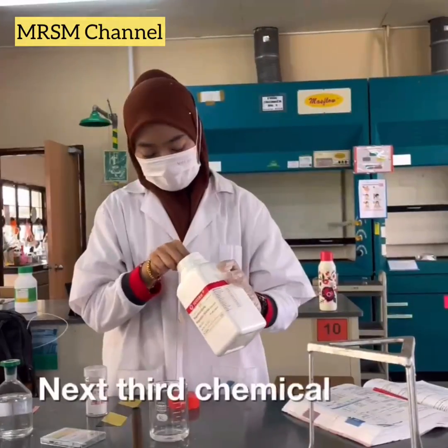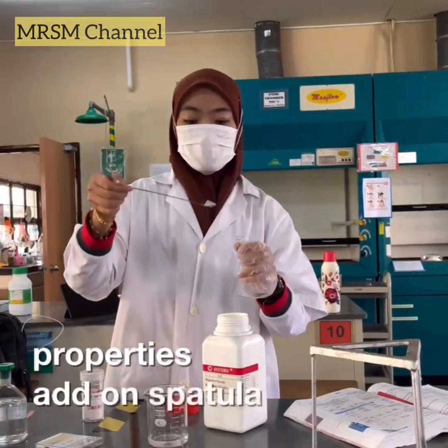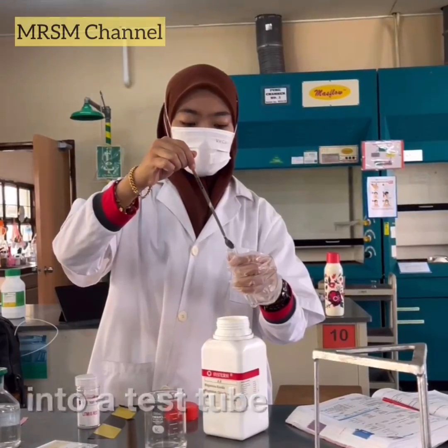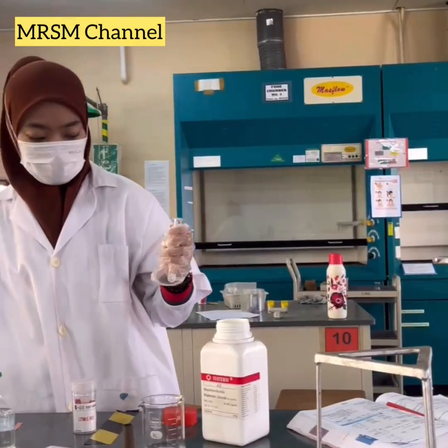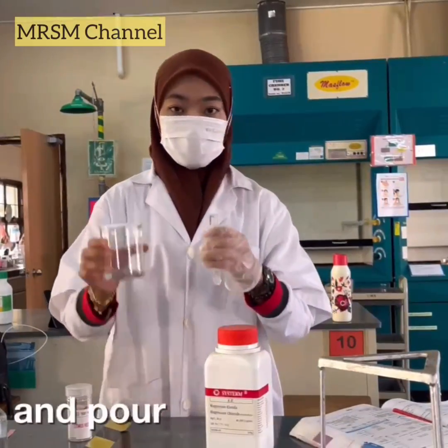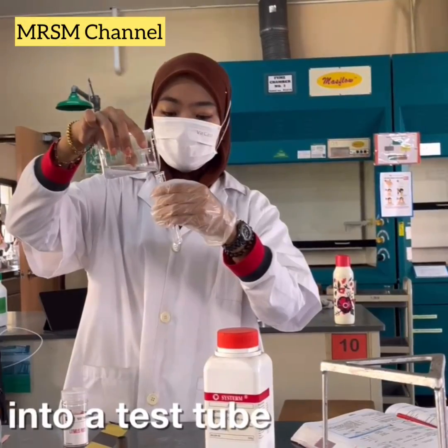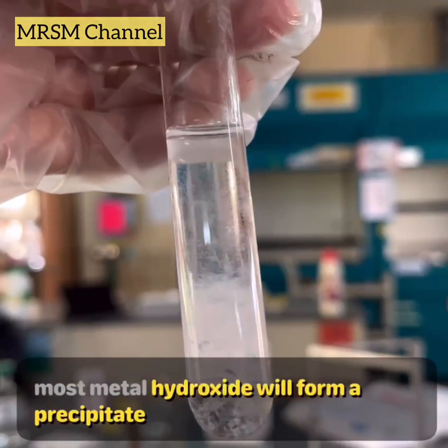Next, third chemical properties. Add one spatula of magnesium chloride into a test tube and pour sodium hydroxide solution into the test tube. The observation is that most metal hydroxide will form a precipitate.